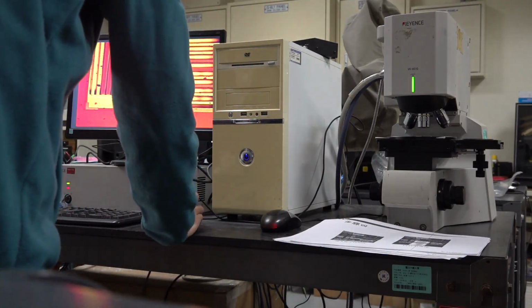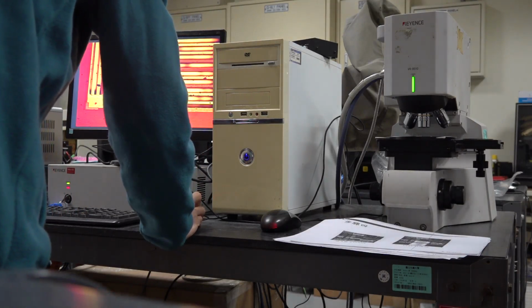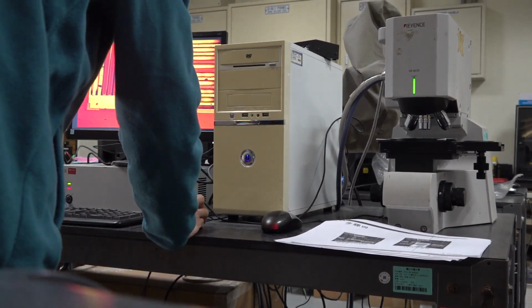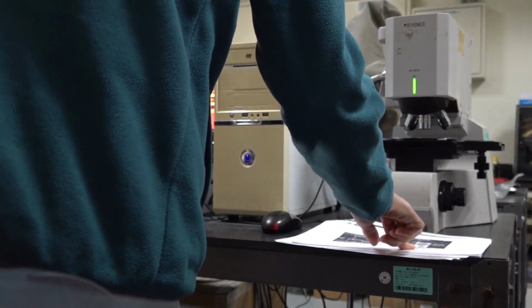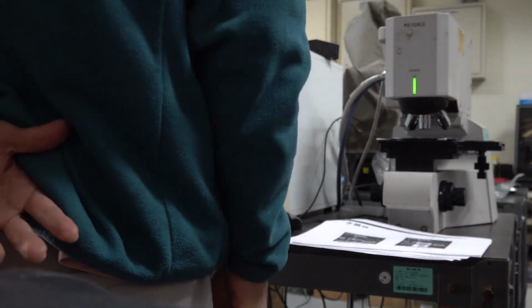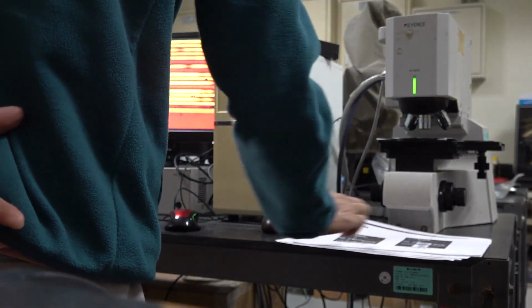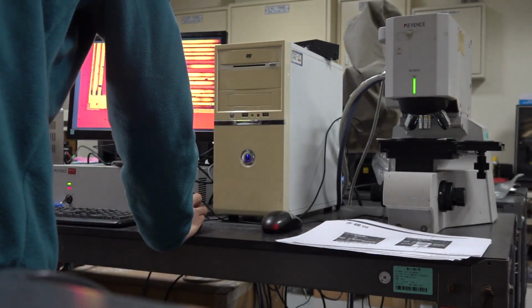Then step 4, we select GAIN. This one is laser gain. So we push down the gain. Then we select pitch. For our micro device, the smallest dimension is around 1 micrometer. So we can select 0.1 micrometer as the pitch mode. Then we go to pitch, select 0.1 micrometer.